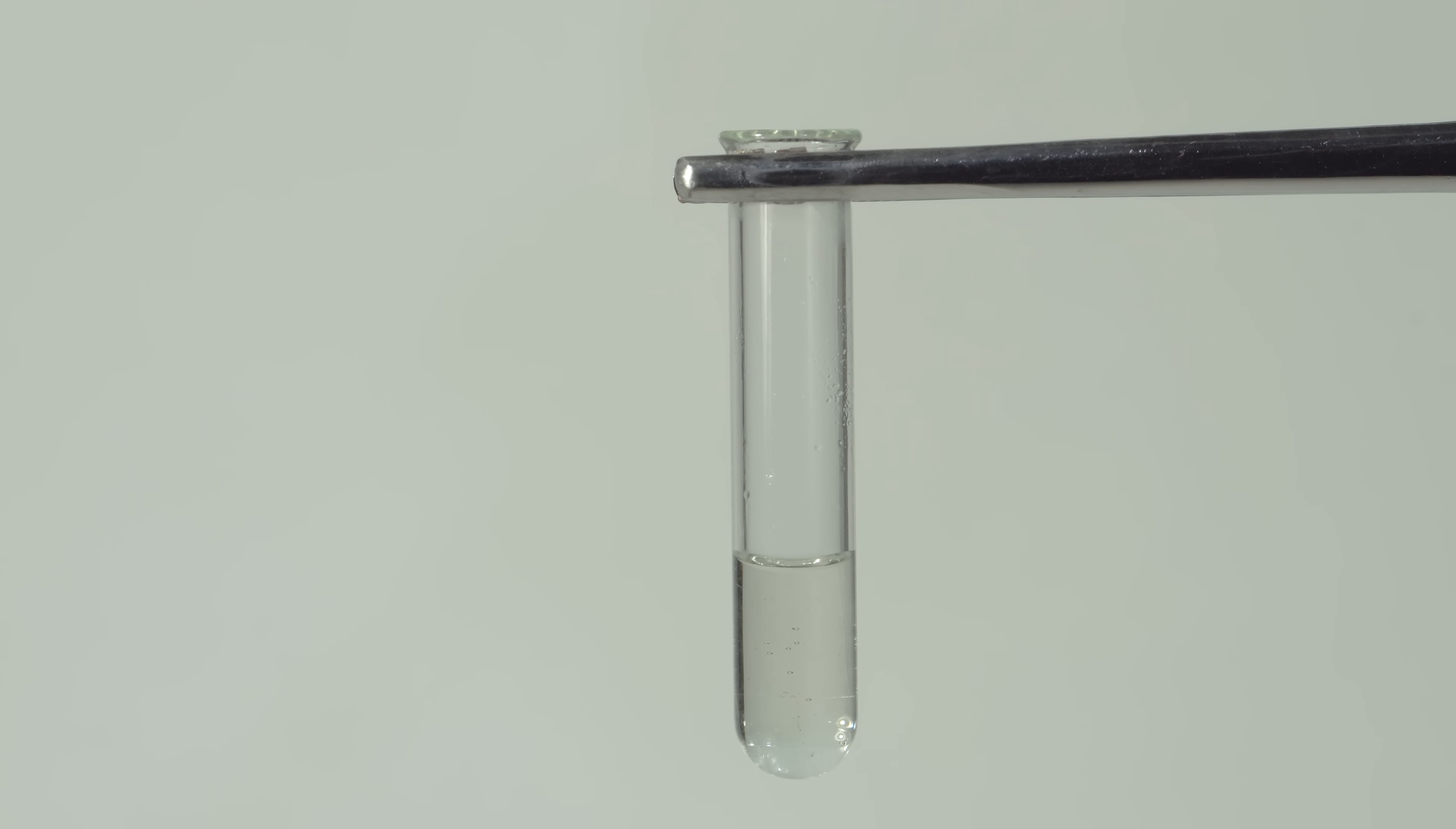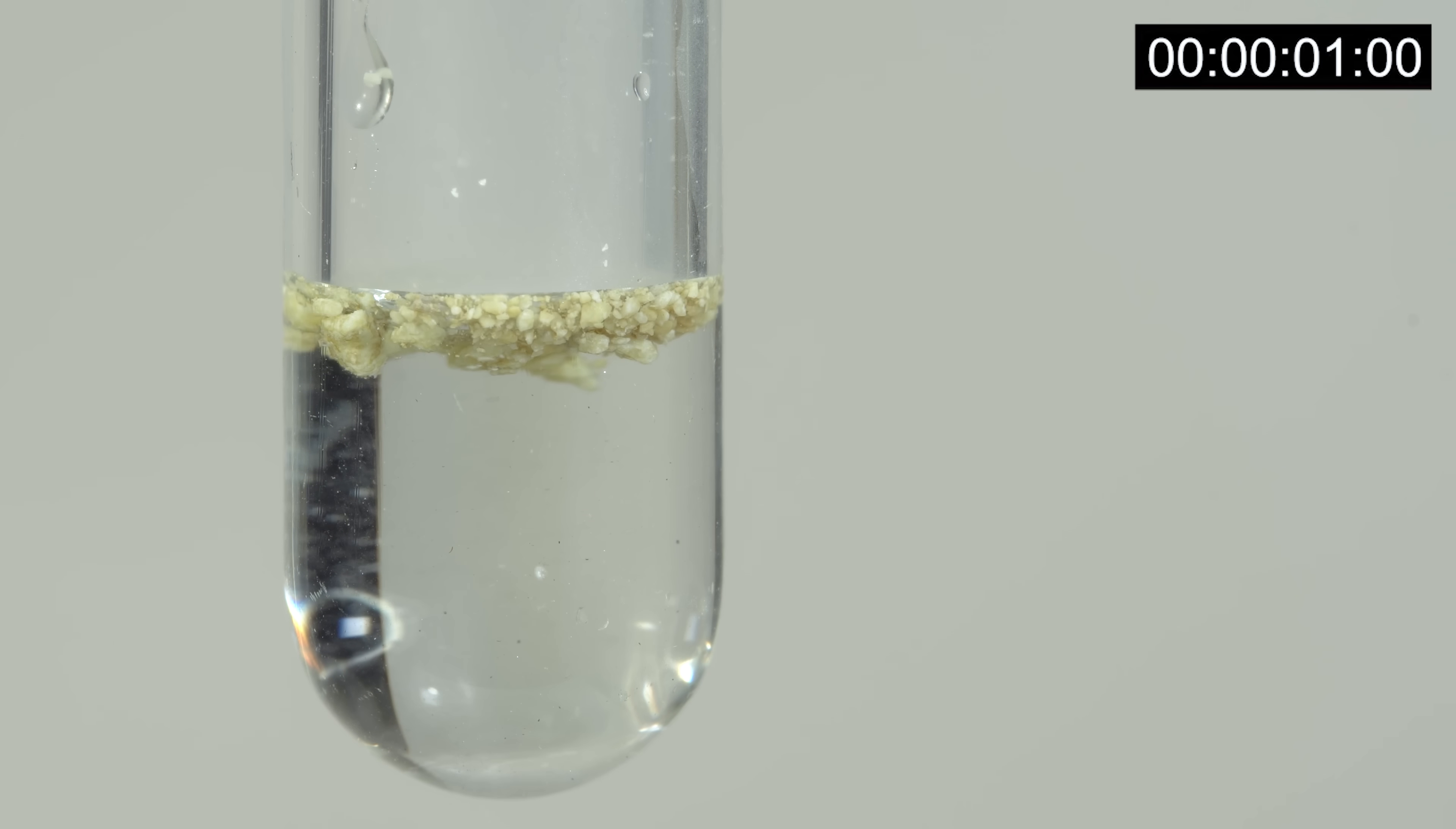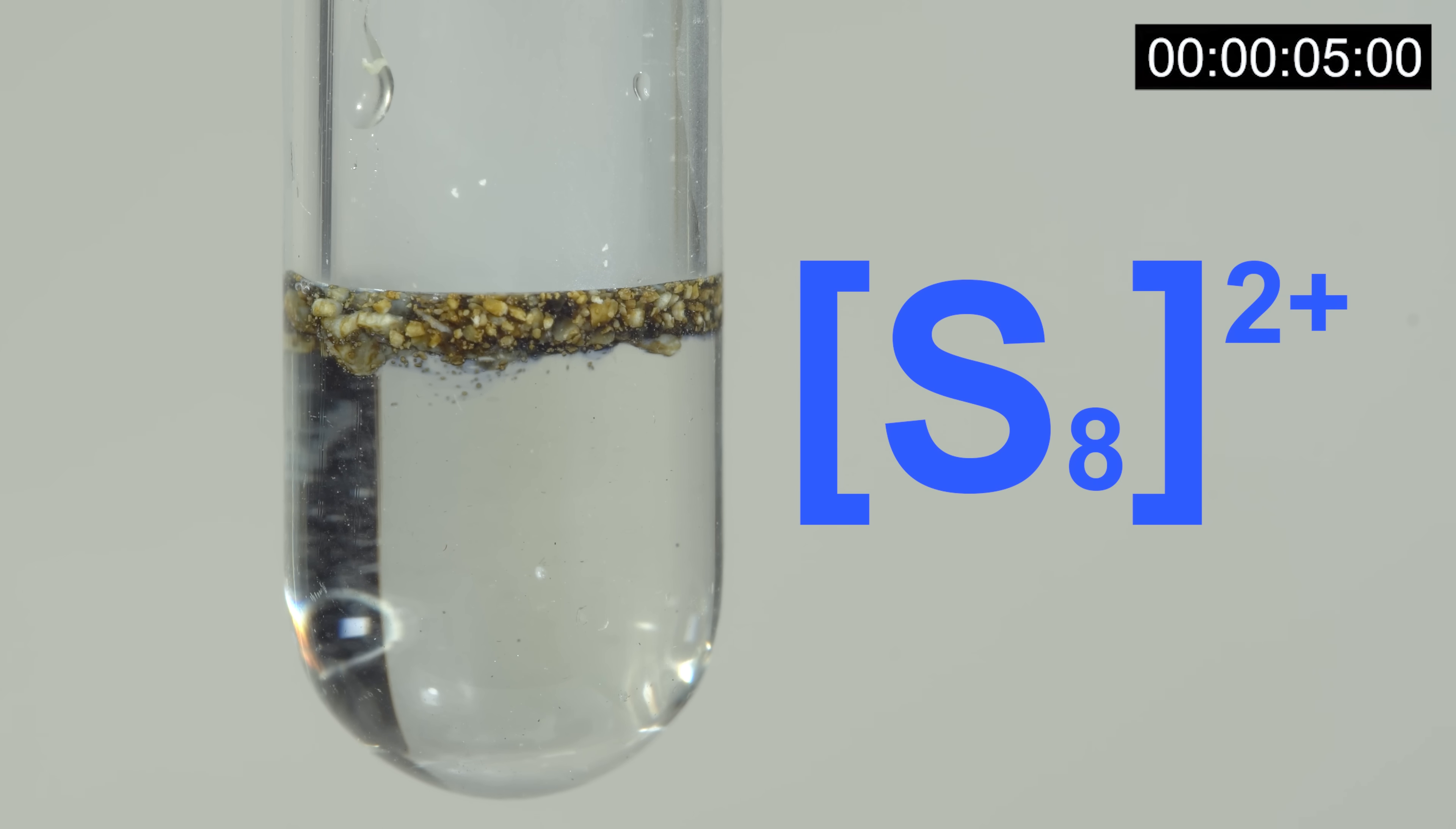Don't worry, guys, we are not done yet. I will show you a few reactions with magic acid. Elemental sulfur dissolves in magic acid, forming S8 2+ cations that give it a bright blue color.